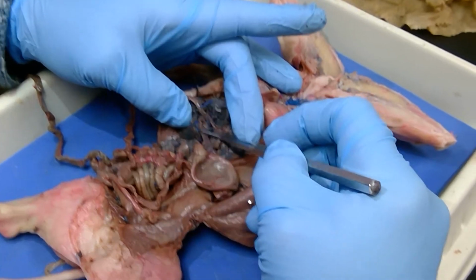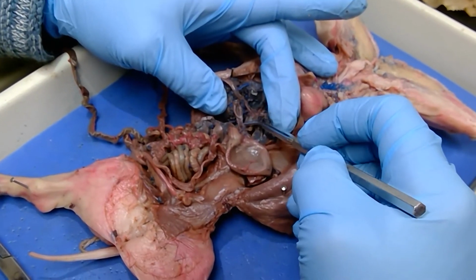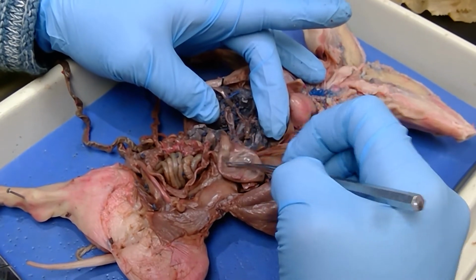This is the gallbladder. If you come down, see how I'm pulling right there and the gallbladder is being pulled down? Well, that tells me that the common hepatic duct is right around in this area here, but it's such a shambles here we can't see it.